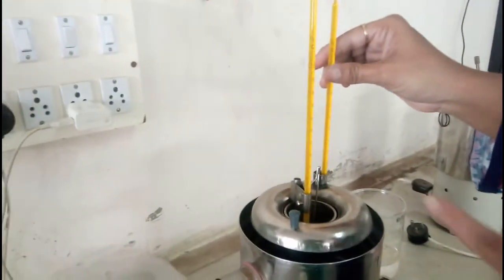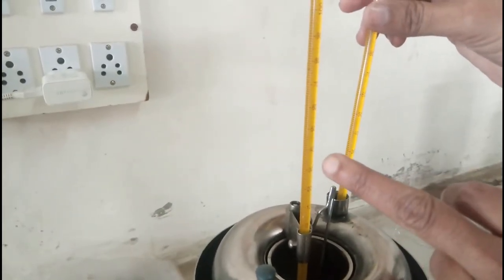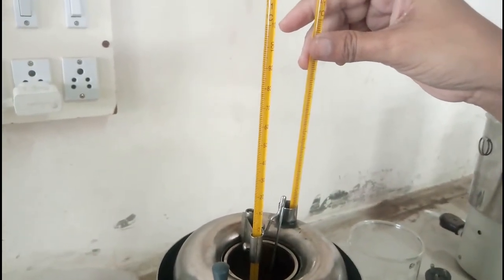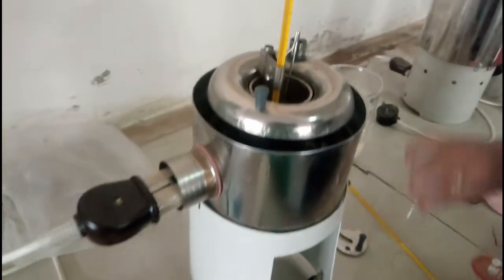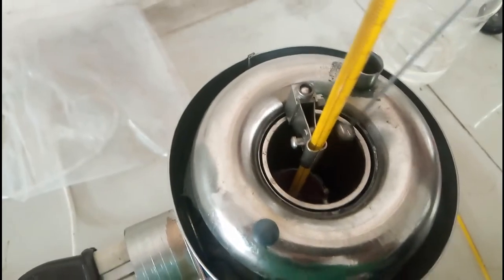Now we have to take the reading at 40 degrees. You can see the temperature of oil has reached 40 degrees — second reading. At that time the temperature of water is near about 46 degrees Celsius. Now what we have to do is the same: I am going to remove this ball from the jet. You can see the oil is coming at a more fast rate — the flow rate is faster as compared to the first one.